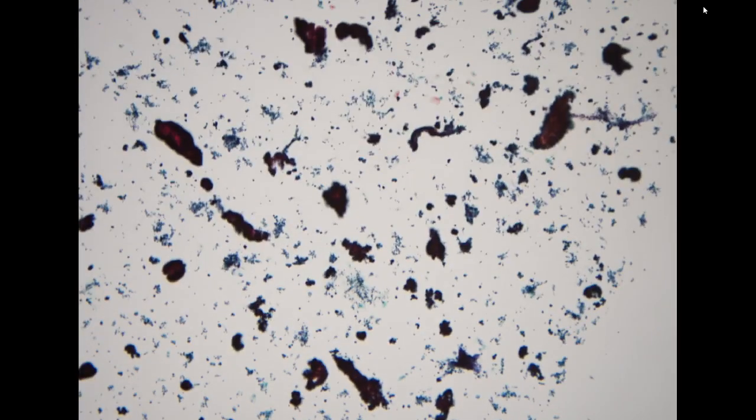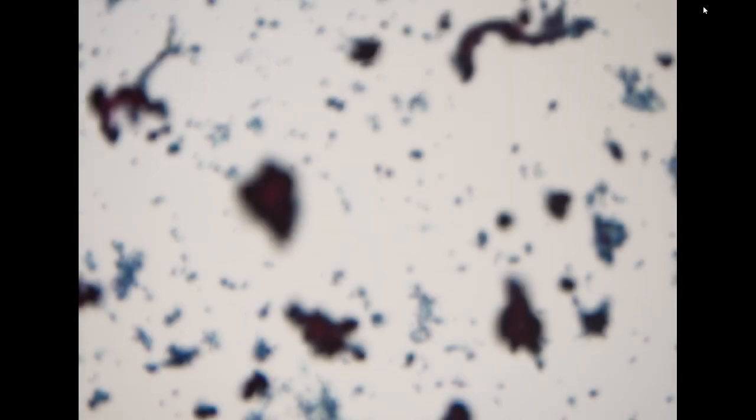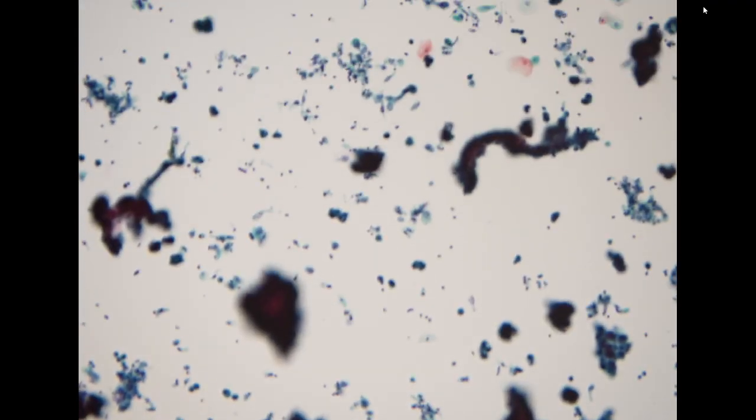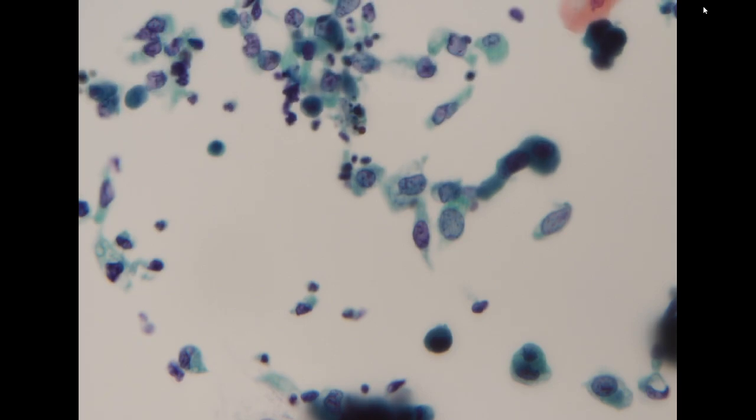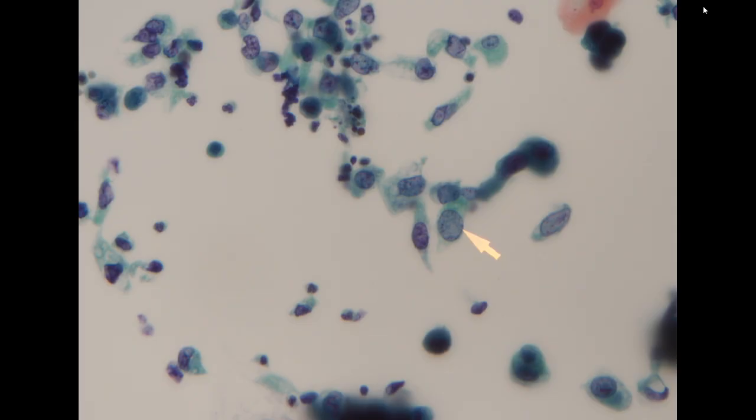So the next specimen is a new patient. It is also an instrumented urine specimen. For this specimen, it is much easier to diagnose because almost every cell looks malignant. Under good fixation, sometimes we will have more apparent hyperchromasia, but in this specimen, you can appreciate the chromatin pattern is more hypochromatic with a very ground glass type of pattern.